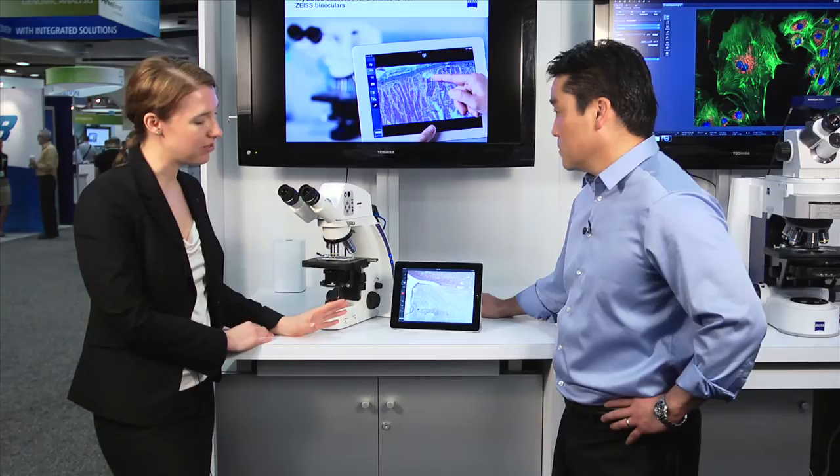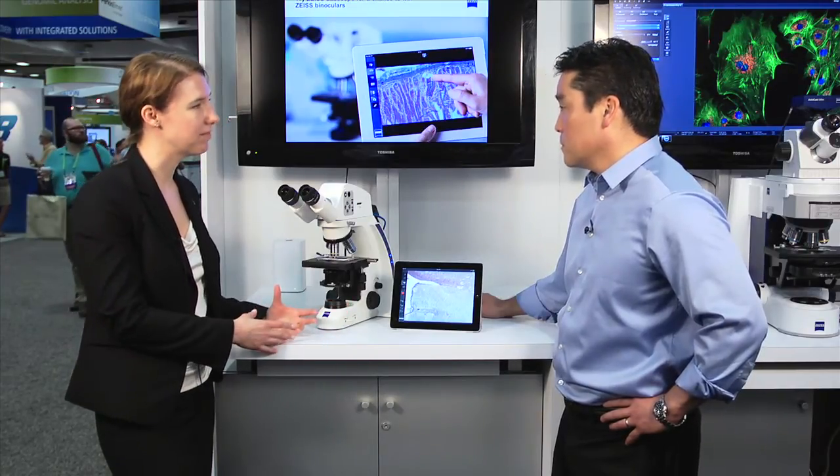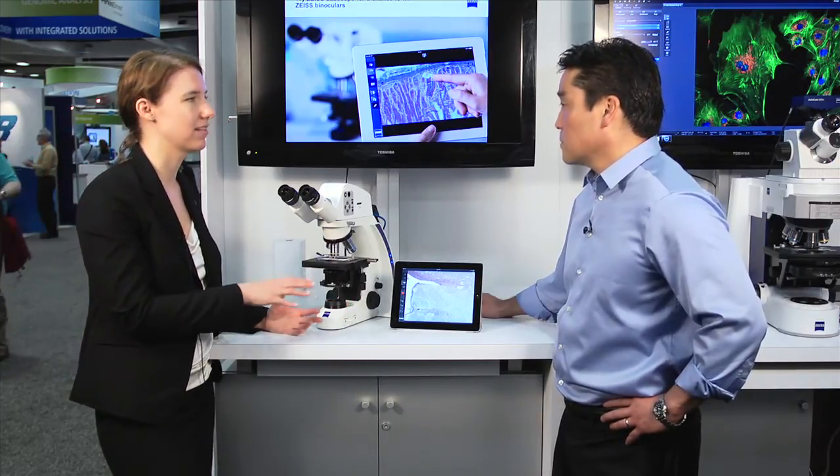All of the images retain the metadata, which means that if you pull the image up later, it saves all the information on the settings that were used to acquire that image, so you can replicate the experiment later on.